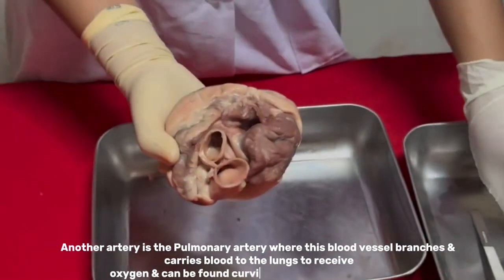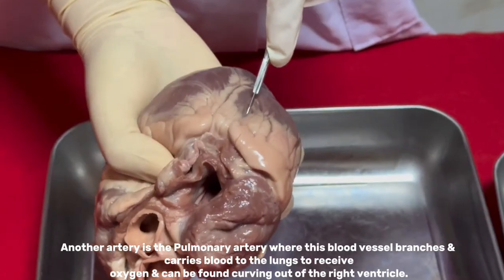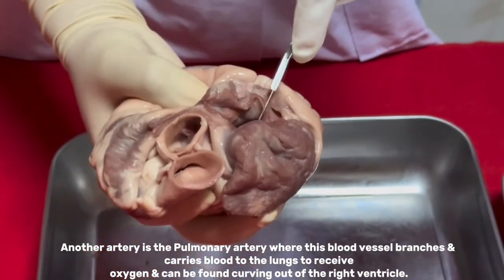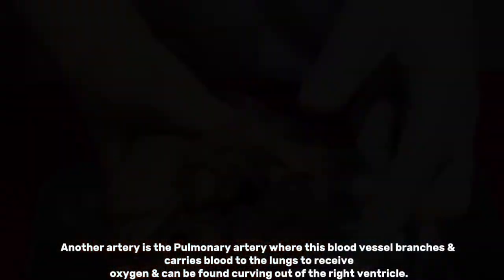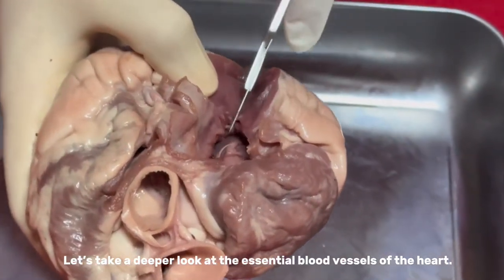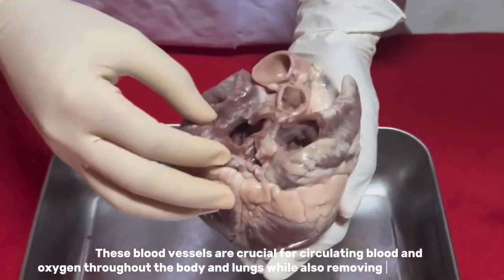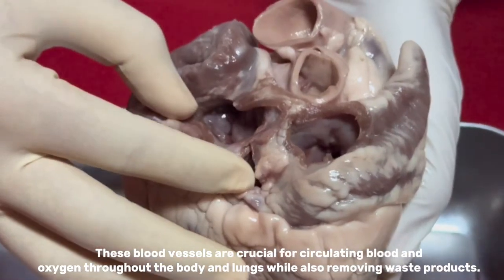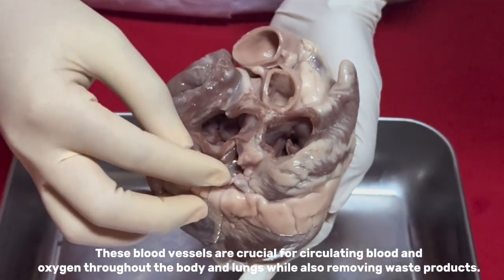Another artery is the pulmonary artery, where this blood vessel branches and carries blood to the lungs to receive oxygen and can be found curving out of the right ventricle. Let's take a deeper look at the essential blood vessels of the heart. These blood vessels are crucial for circulating blood and oxygen throughout the body and lungs, while also removing waste products.